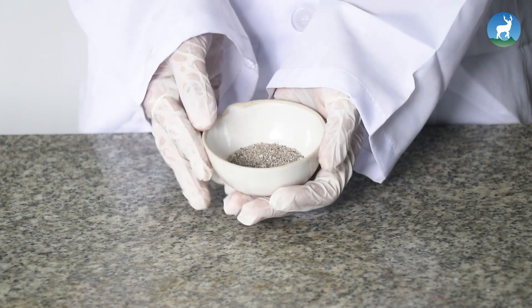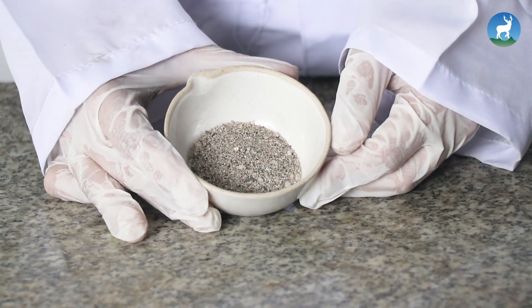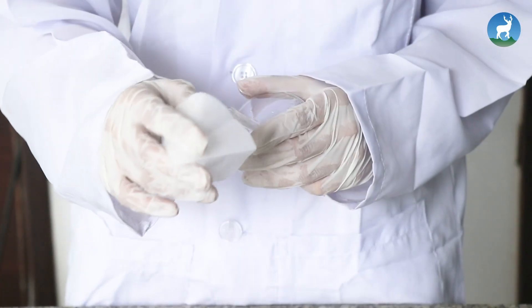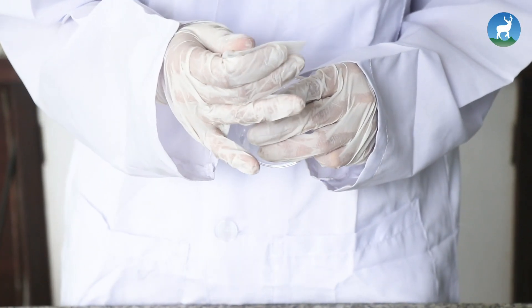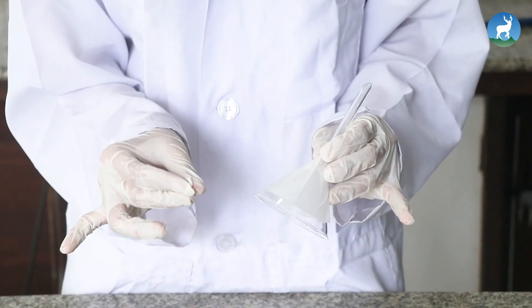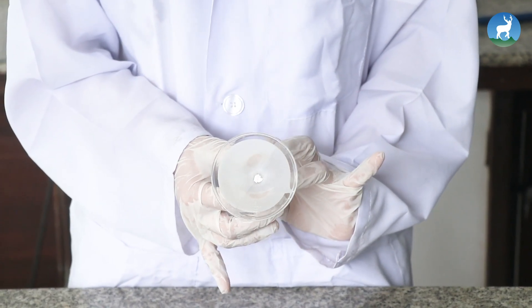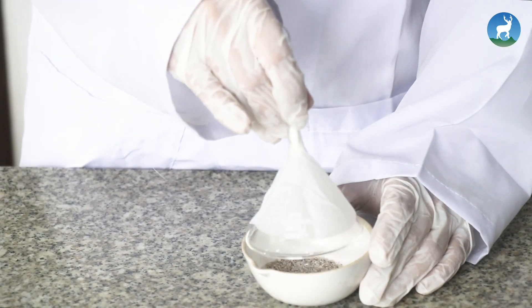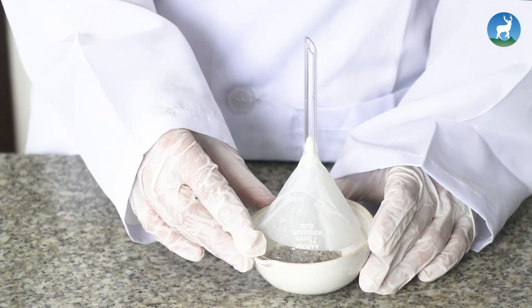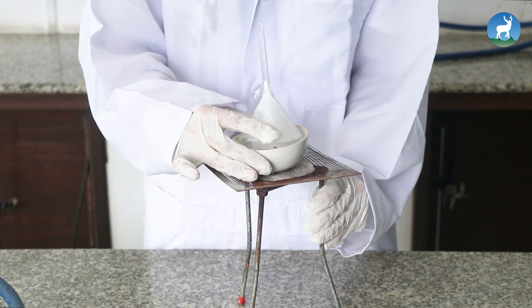Take the given mixture of sand and camphor in a clean porcelain basin. Wrap the outside of the funnel with moist filter paper and close the open end of the funnel with a small piece of filter paper from inside. Invert the funnel over the porcelain basin and keep the porcelain basin on the wire gauze over the tripod stand.